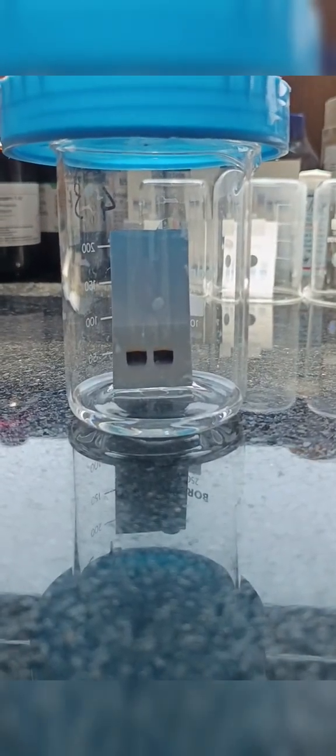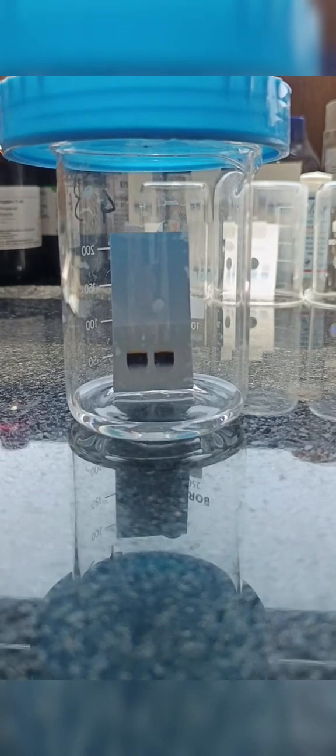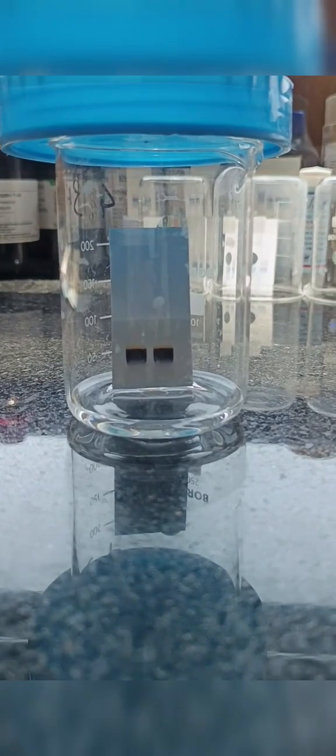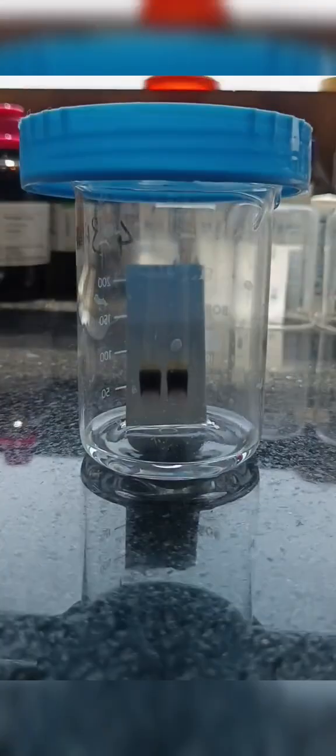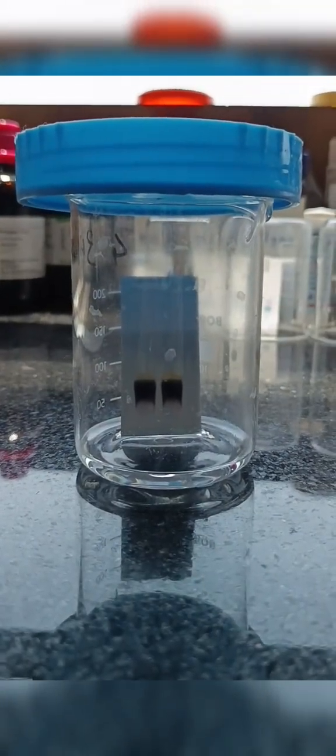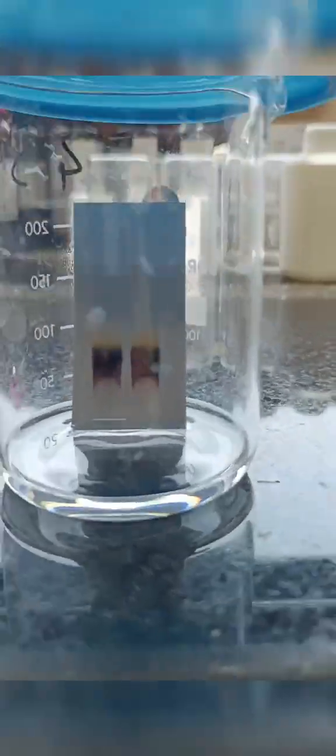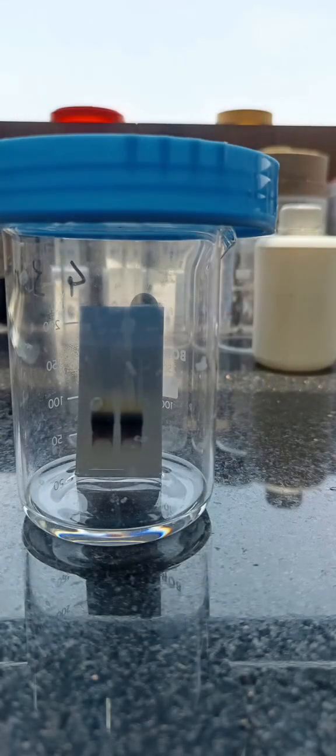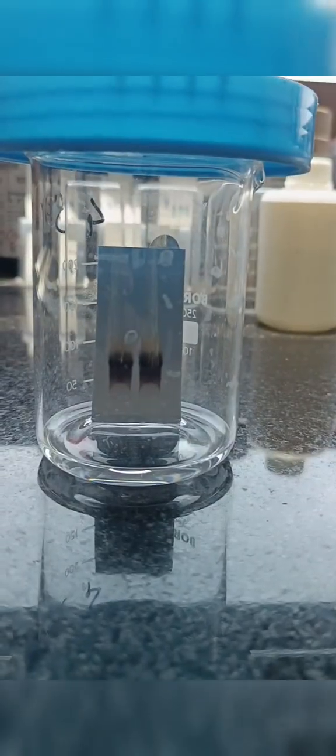Now as you can see, the bands are slowly separating. This process usually takes 20 to 25 minutes. Now as you can see, the bands have clearly separated out.